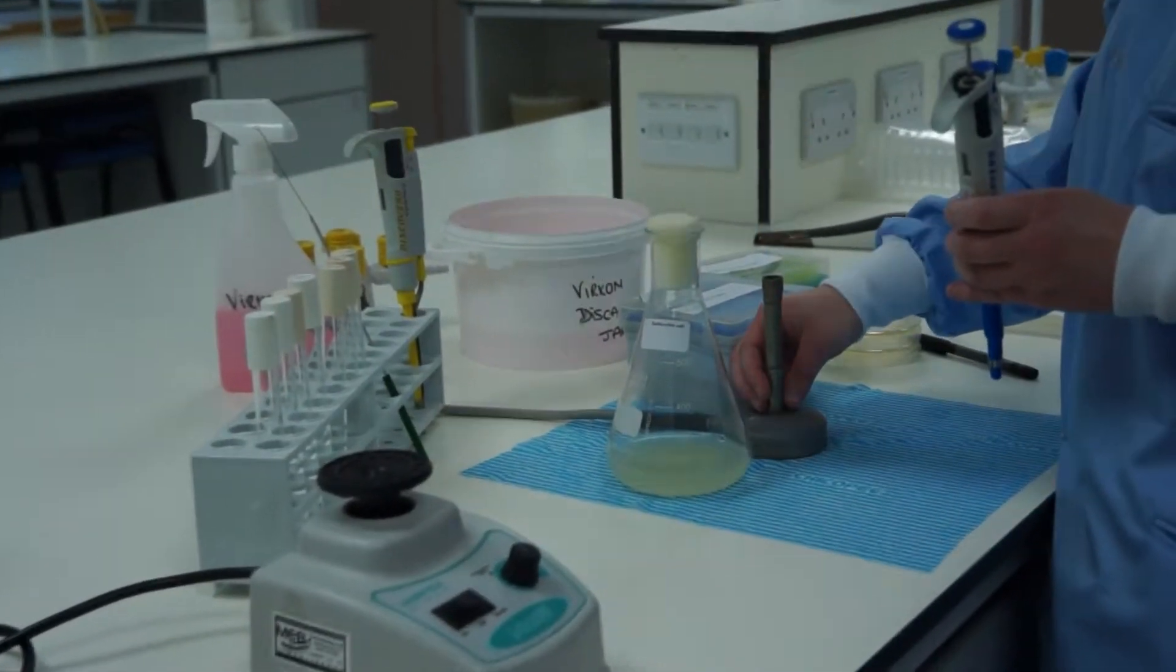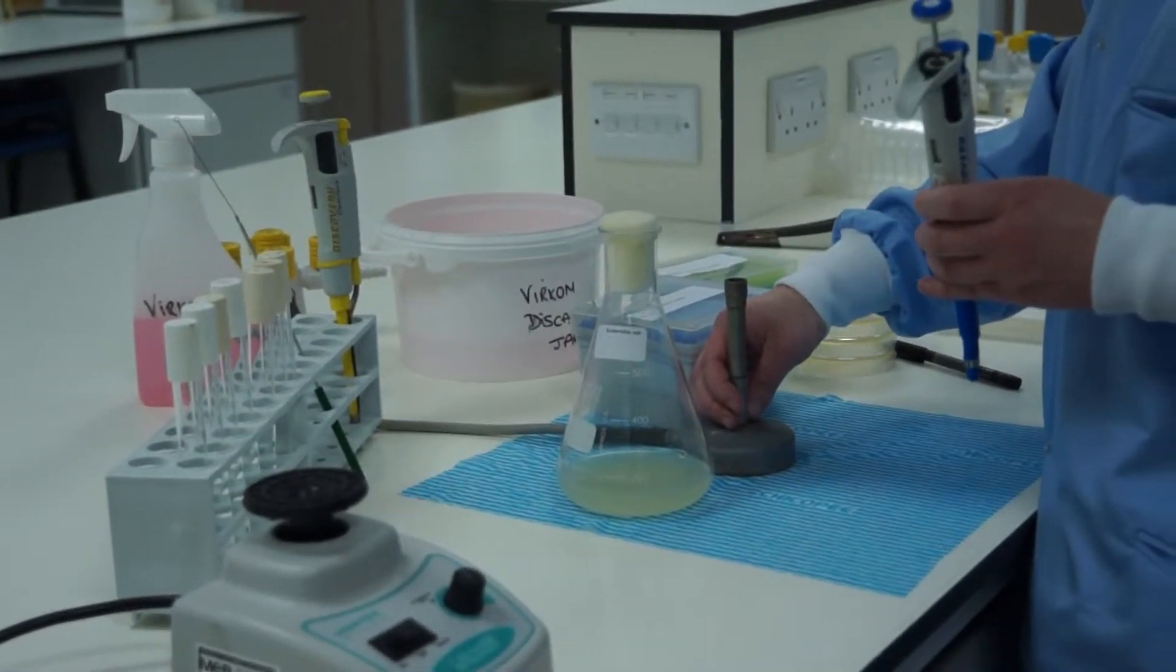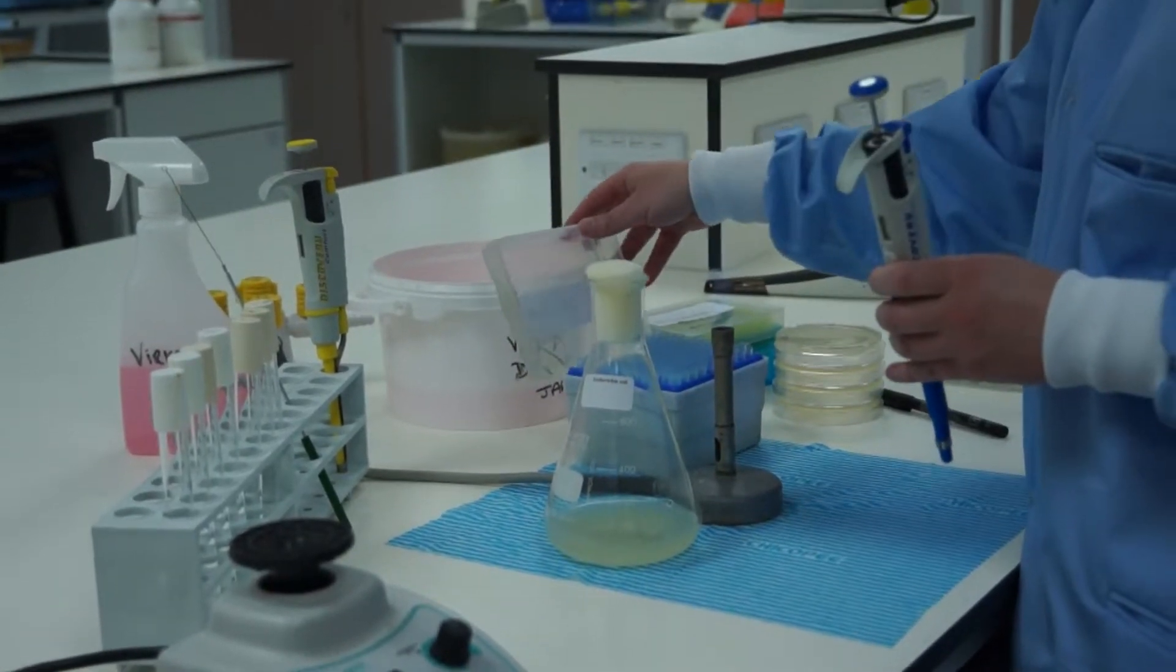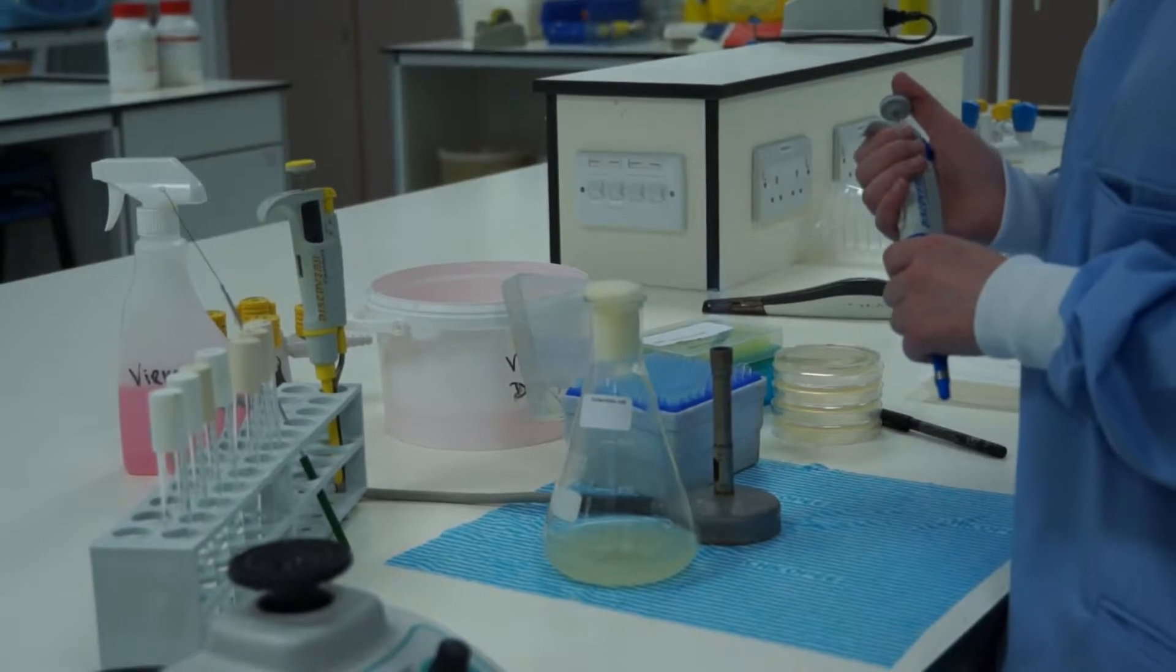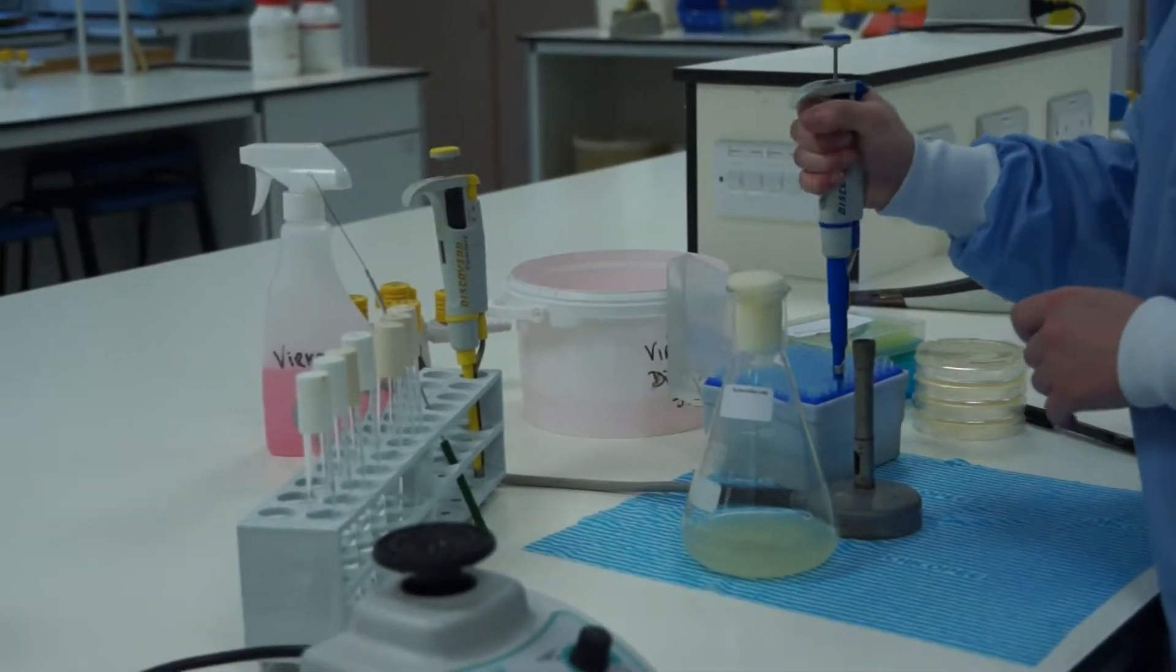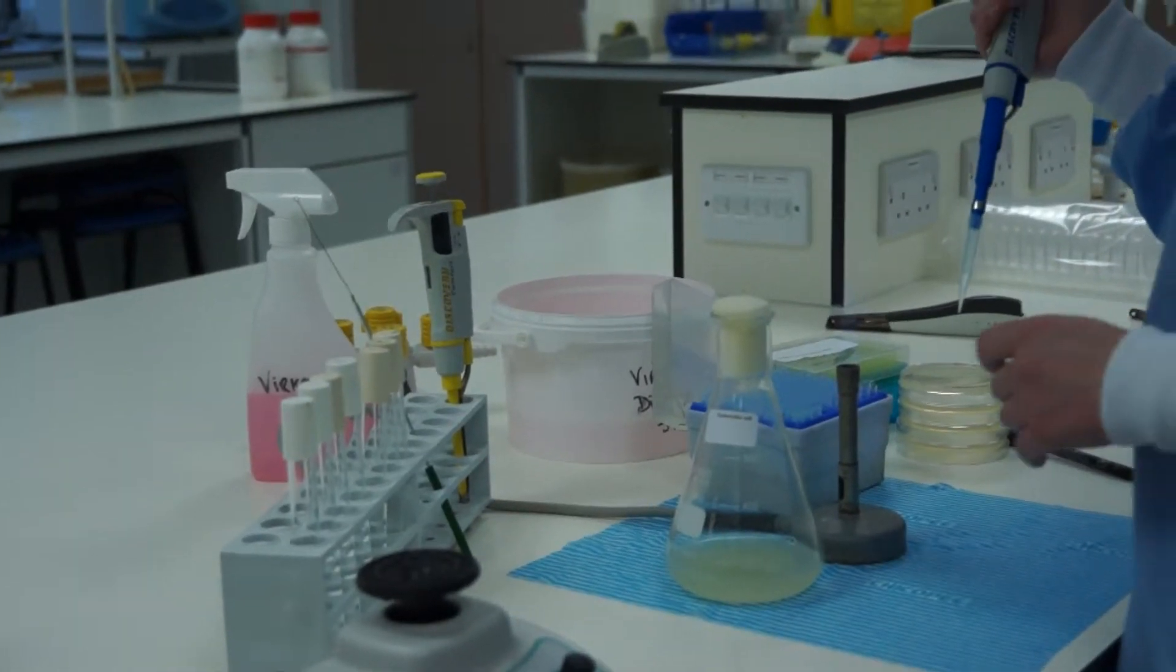Within our clean space, we turn our flame onto our blue working flame. We can now open our pipette tips. We load our 1 ml pipette.